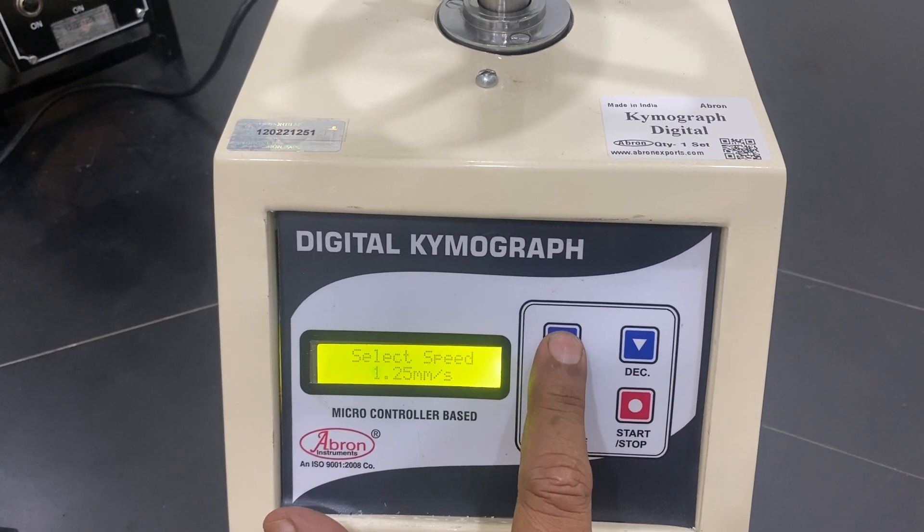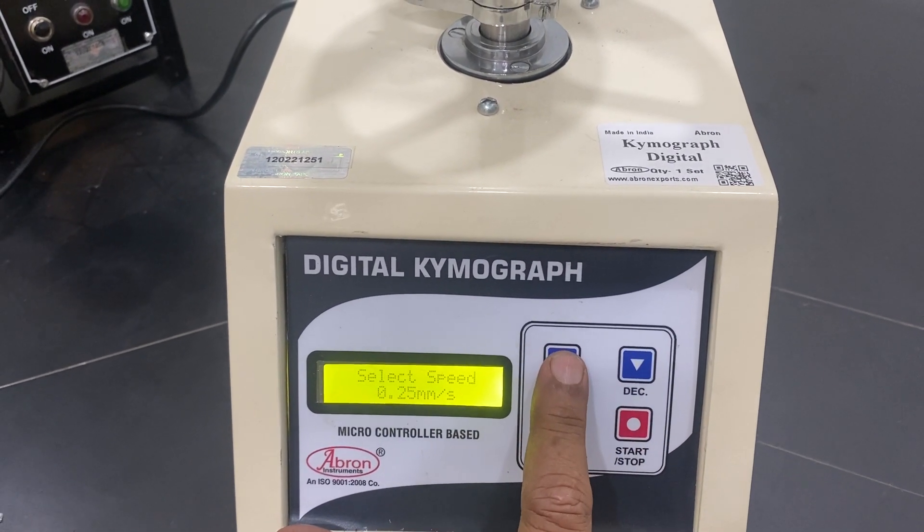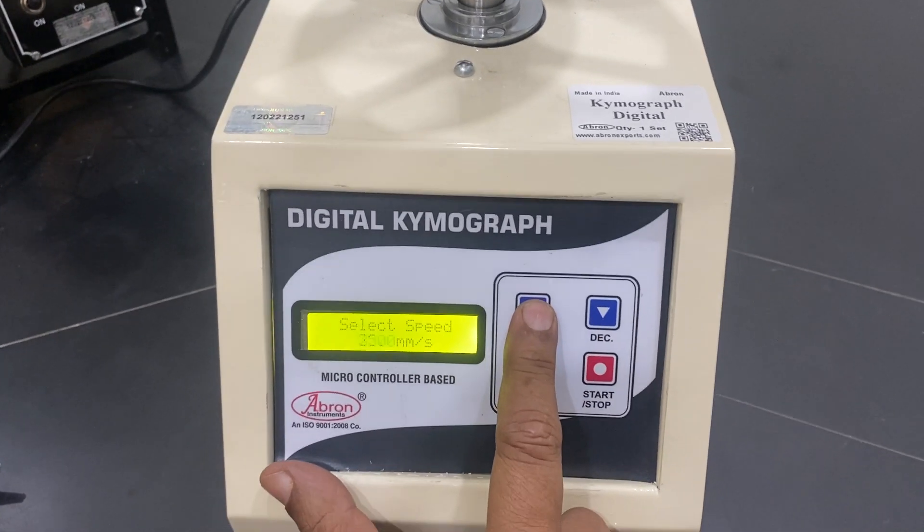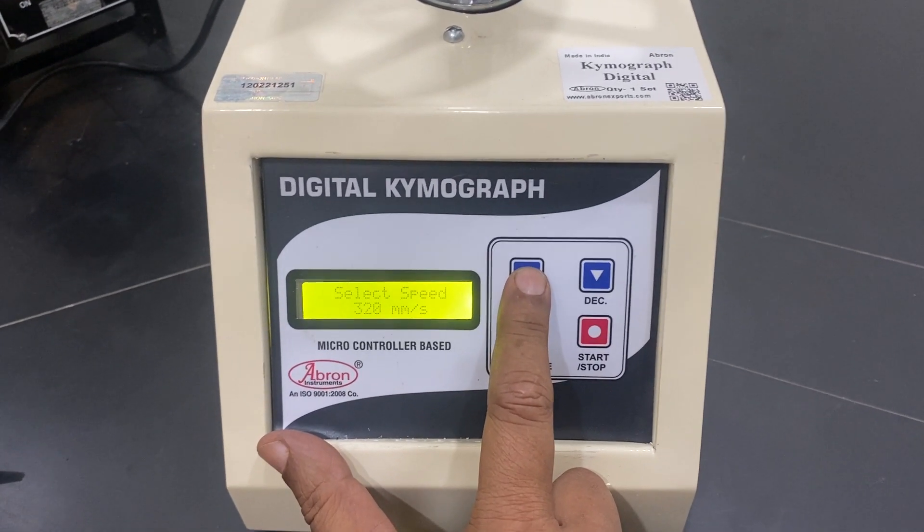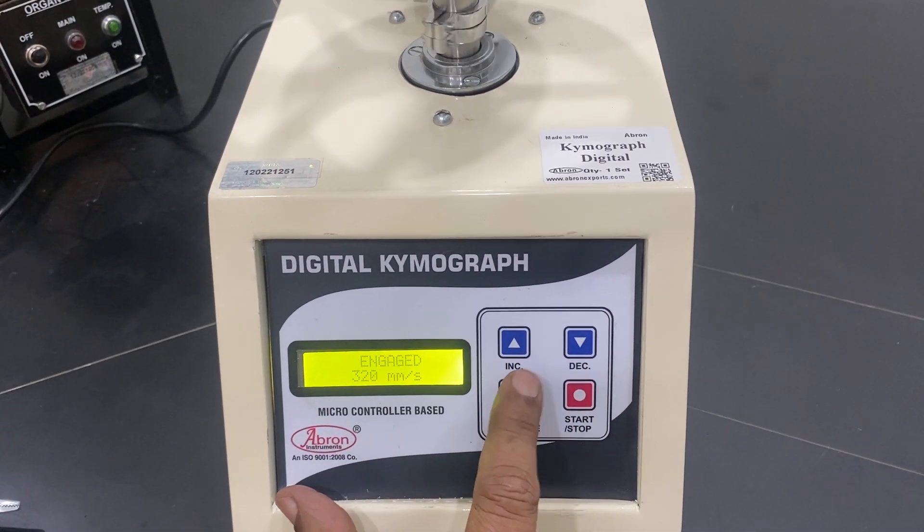These two are slowest speeds, two are medium, two are faster, and these are super fast. You can see if I just engage it, it starts working.